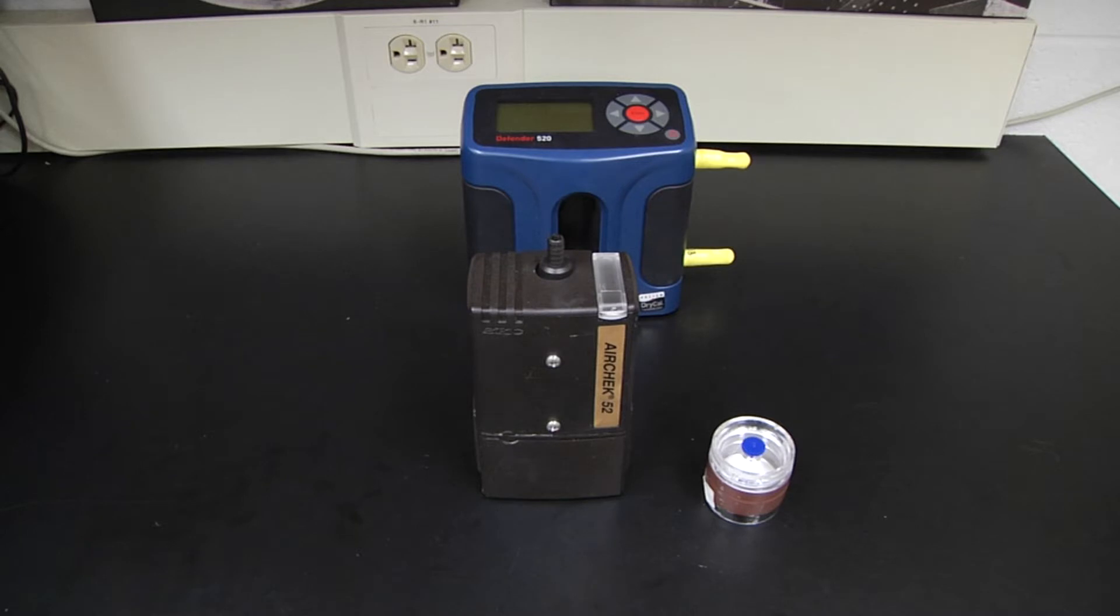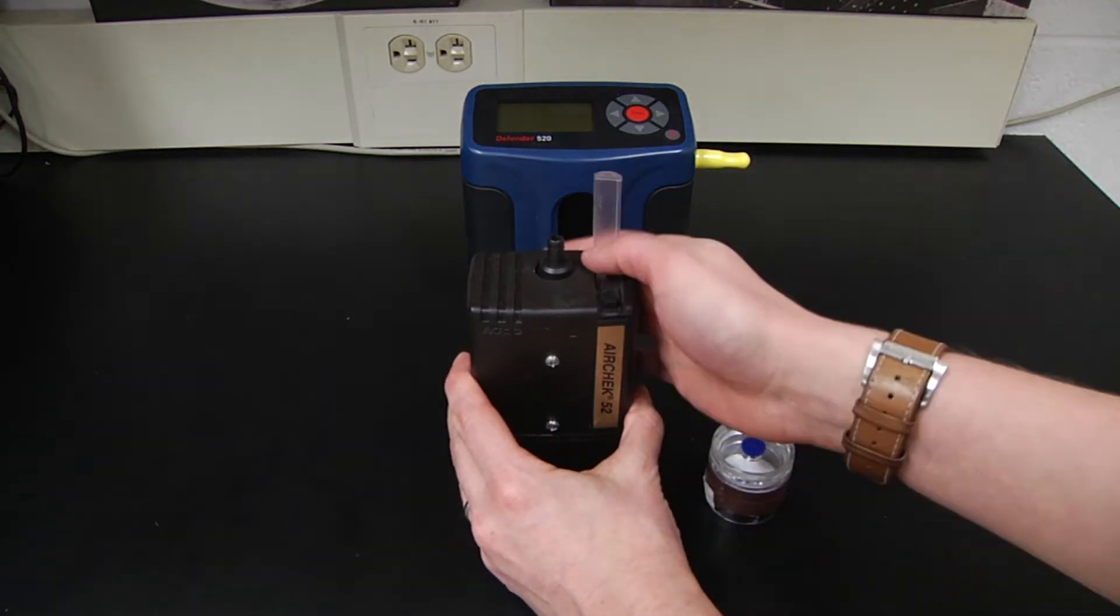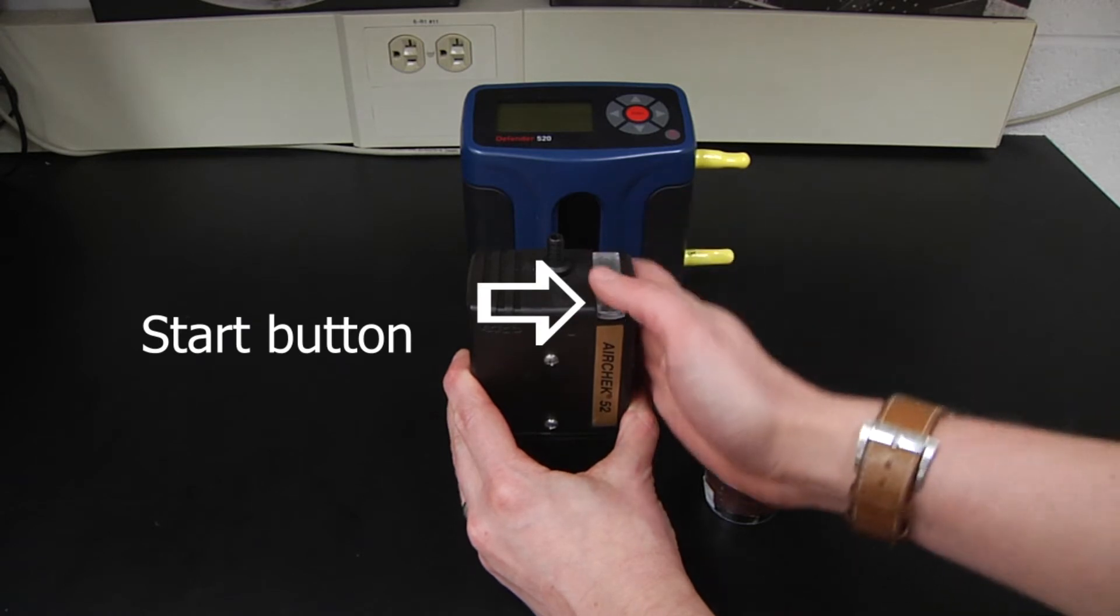First, we want to ensure that our pump is fully charged and we need to have it running for at least five minutes before performing the calibration.